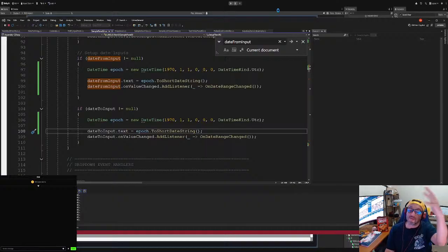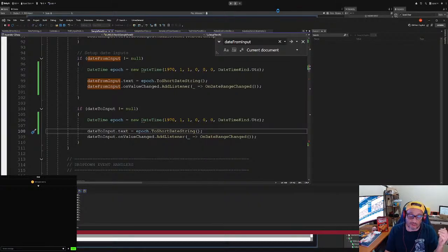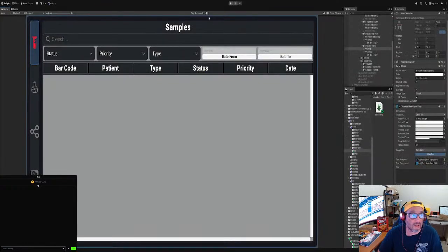So what we're doing, we're getting all the records from 1970, which, this is a new app, so you wouldn't get it unless some people might do some historical sampling things. Actually, this is bothering me, so let's just fix it real quick. Normally it wouldn't, but just for you guys. All right, so layout. You just add a layout, and we say height is 25, I believe, and then width is whatever the width is right here. Then we want it to be non-interactable because we don't need it to be interactable. It keeps from getting bugs, and that's good. All right, so let's see if it works.